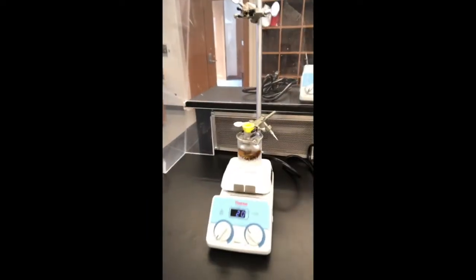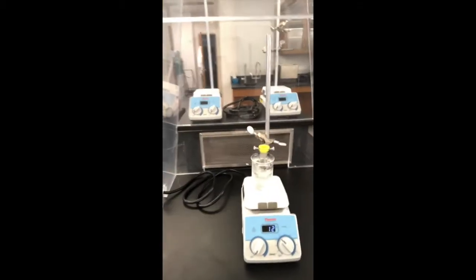All right, so here we have our reactions going. I'm going to just let them sit on ice and react. There's our control. And I'll get them a little bit later, either this week or maybe next week. We'll kind of see how things go.